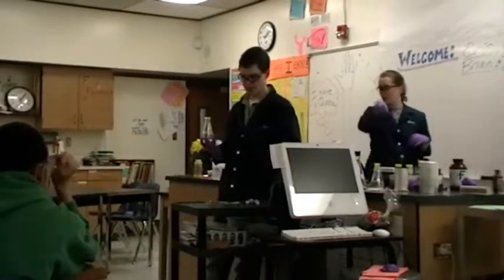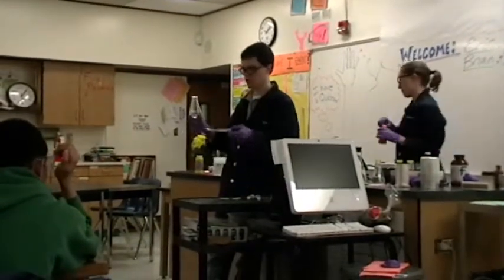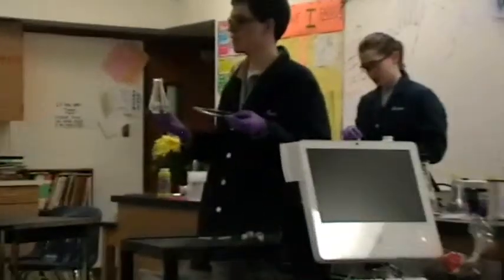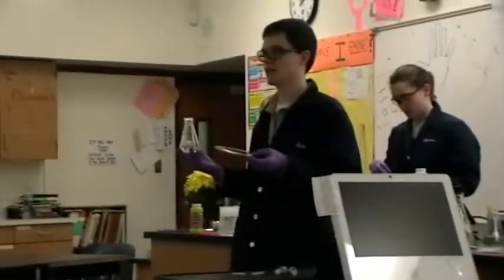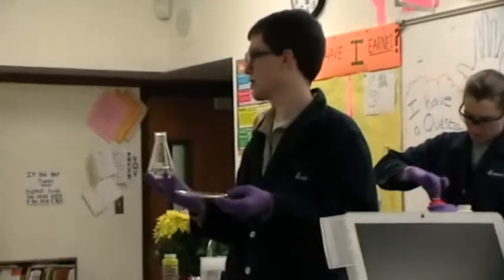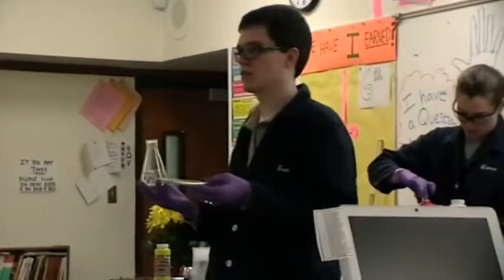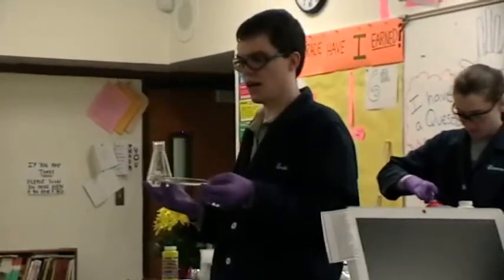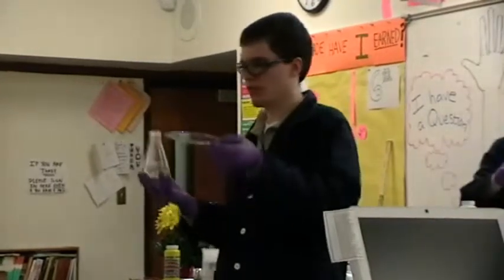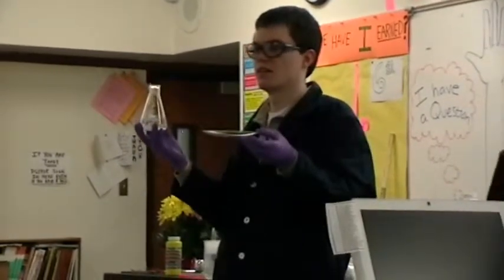I'm going to show you an example of that. What I think I'm going to do is try and pour this liquid onto a plate. Has anyone here ever poured a glass of water on a plate? What happened? It spills over. It depends how you do it. Do you think all this liquid is going to fit on the plate here? No.